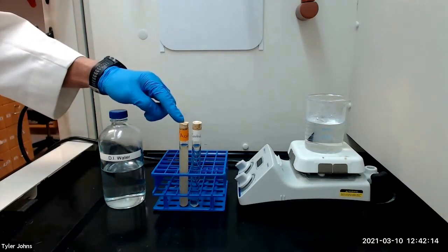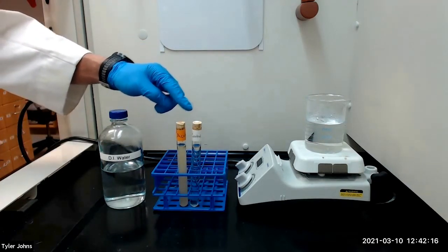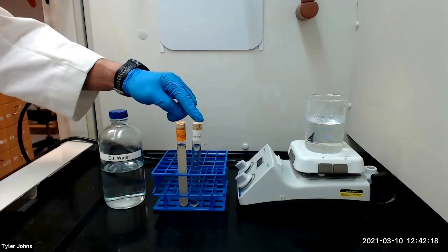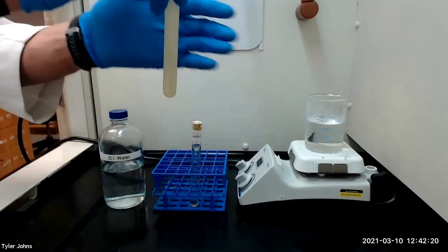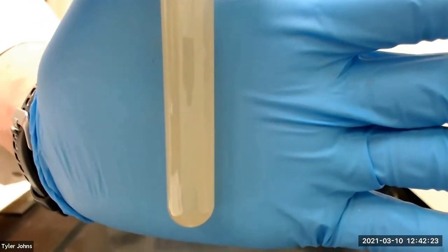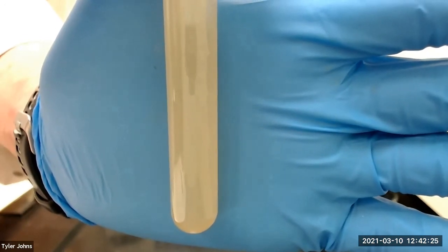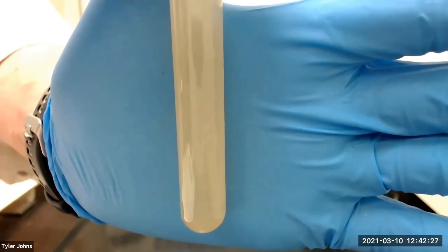After 15 minutes, this is what our test tube with the acetone looks like and what our negative control looks like. The appearance of a pale yellow precipitate of iodoform that will slowly settle to the bottom of the test tube indicates a positive test.